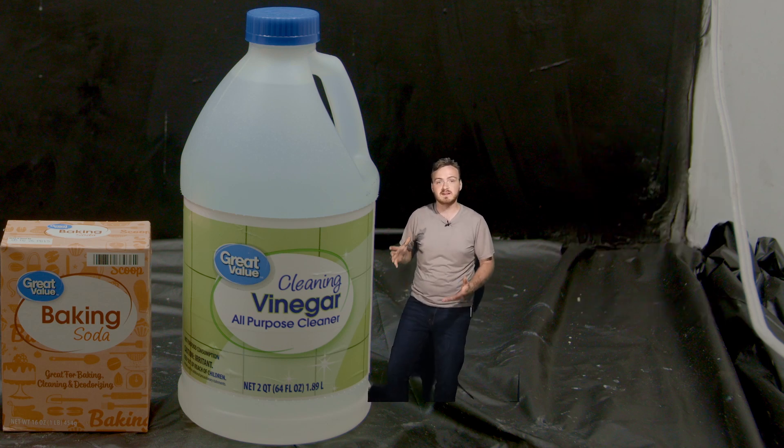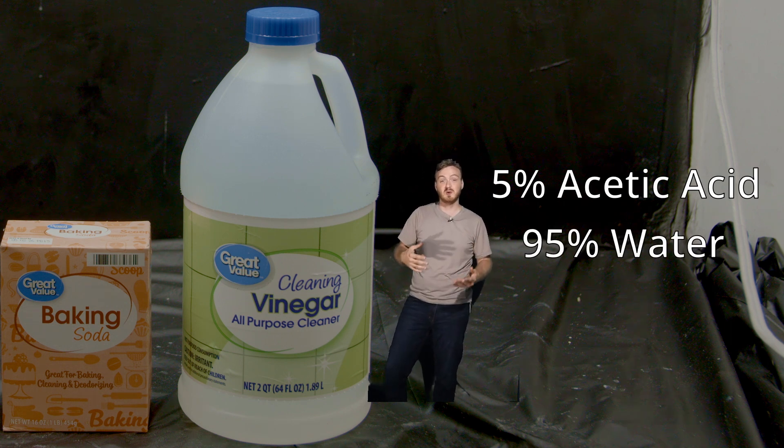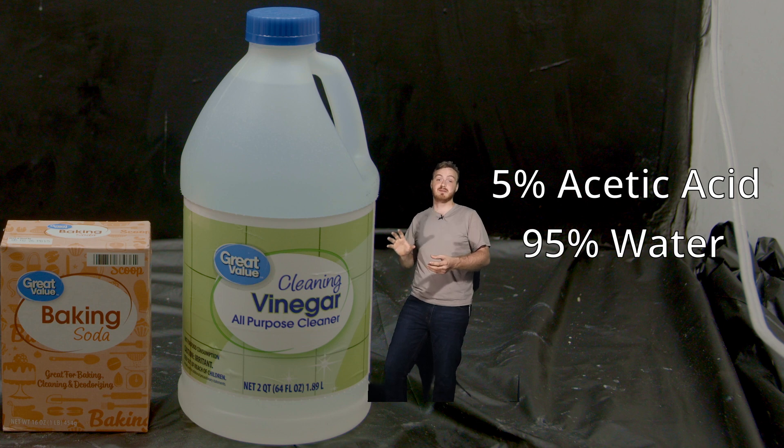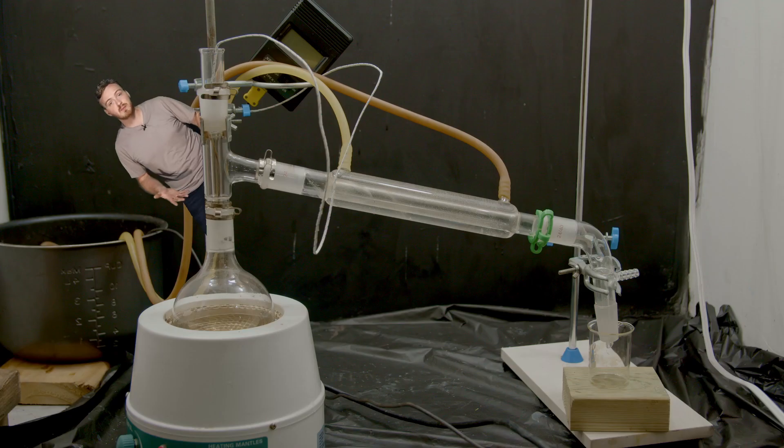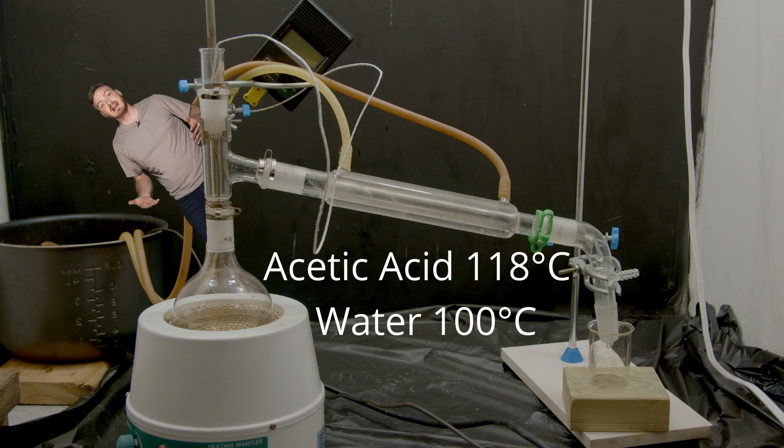So the thing with vinegar is it's about 5% acetic acid, 95% water, so we're going to have to do a lot to get that 95% of water out of there. Normally I would say just distill it, but the boiling points for water and acetic acid are just too close, so it doesn't work.